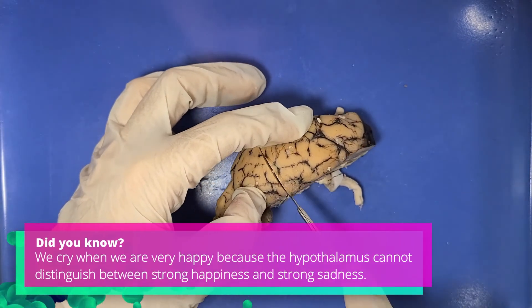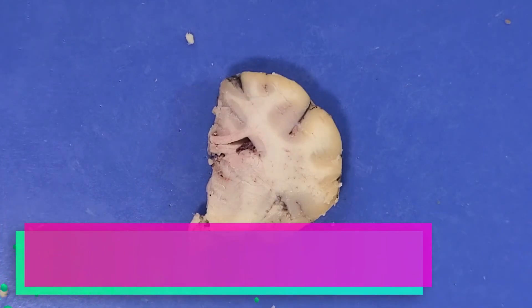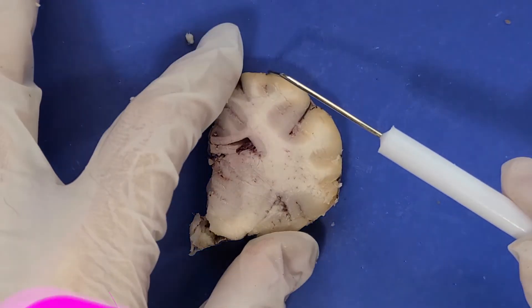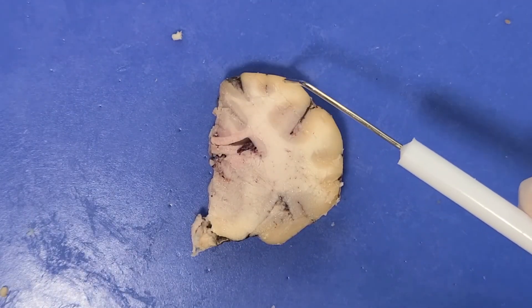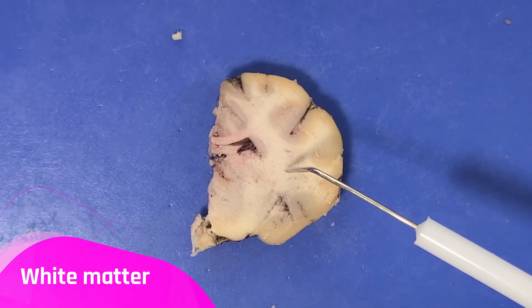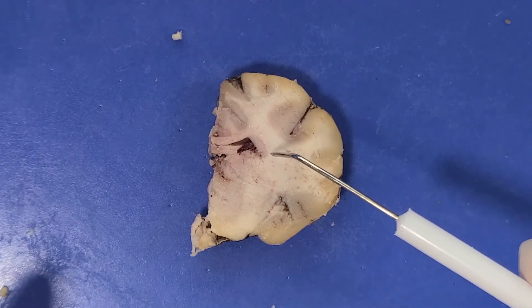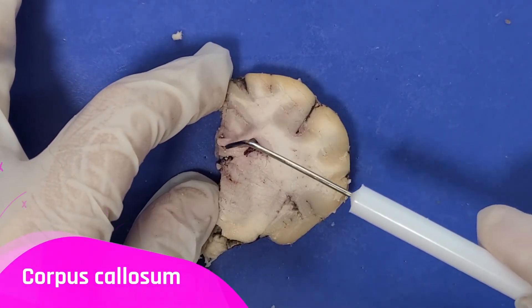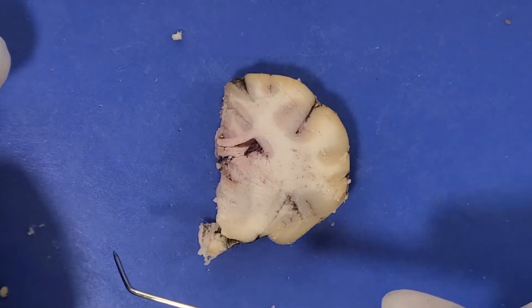Now I'm going to cut a cross section of the brain. In this cross section you can see the gyri and the sulci. You can also see a layer of beige area around the edges — this is the gray matter. The white area in the middle is called the white matter. Gray matter consists of cell bodies, like neuron cell bodies and glia. White matter consists of axons. You can see that the corpus callosum, which we cut through earlier, consists of a band of white matter that connects similar areas in one hemisphere to the other.